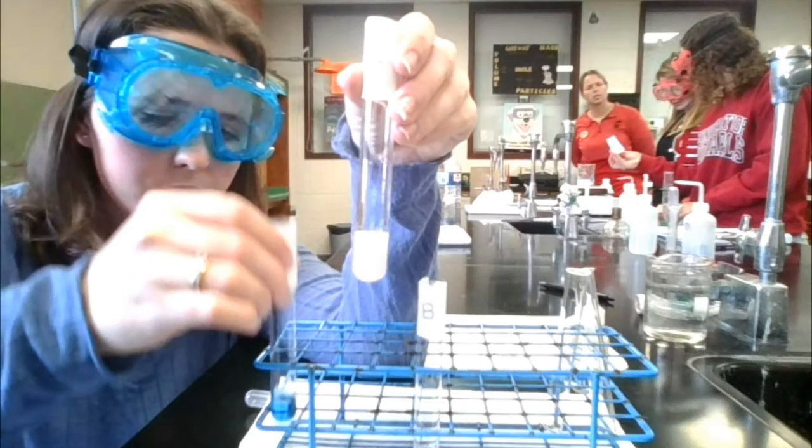So what's happening here is an odd case. It's not just an interaction between ions in the solution. It's a direct reaction that forms a precipitate. So you'll see with the addition of the silver nitrate, it will form that white precipitate. That is silver chloride. The silver nitrate is going in and it's latching onto that chloride and it's pulling it out of solution. So there's no more of the chloride left in the solution.